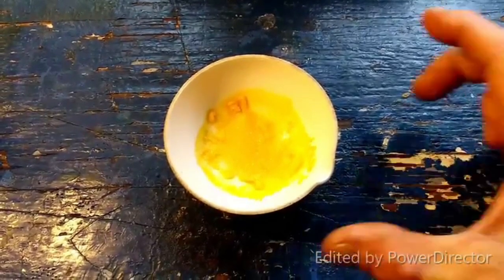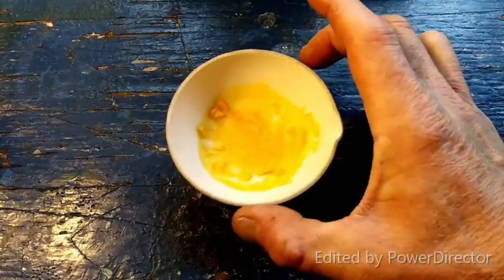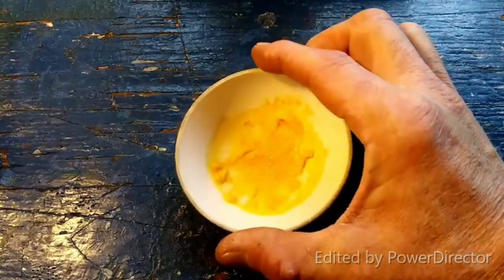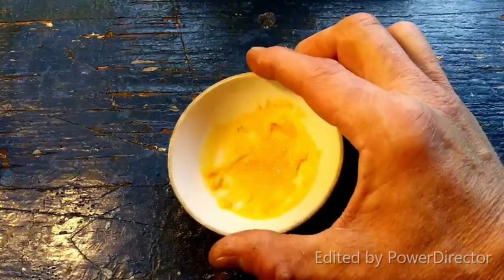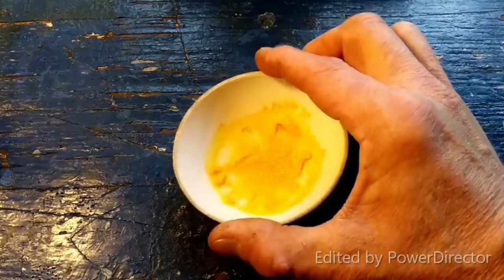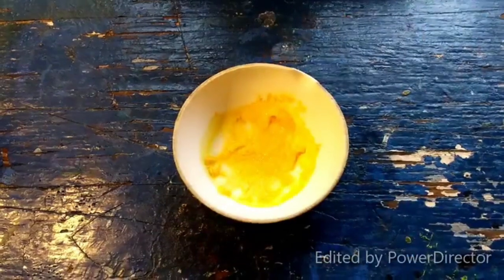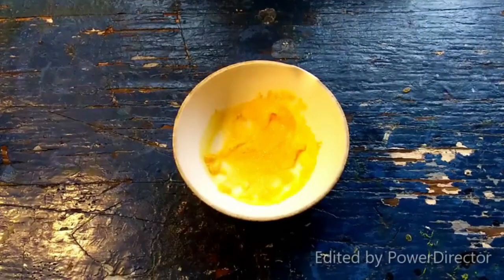Would you look at that? That is beautiful. Nice, pretty, sparkly crystals. Oh, that is gorgeous, man. Well worth all the effort. All I'm going to do now is scrape this up and put it into a bottle.